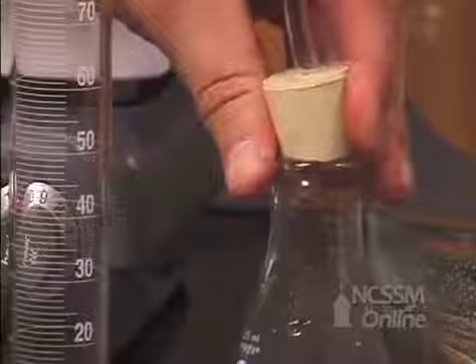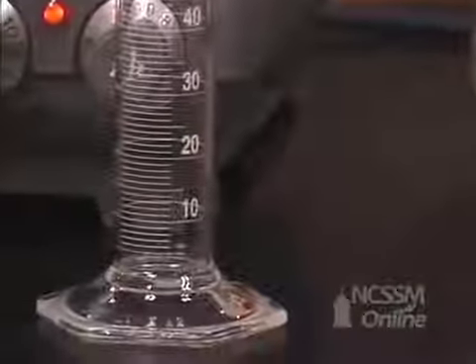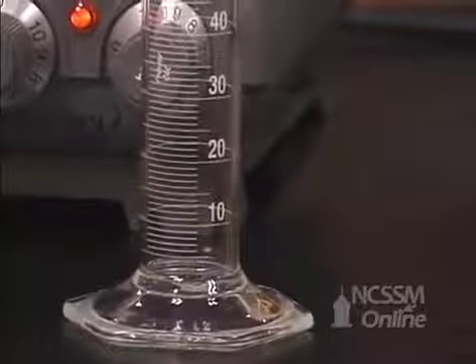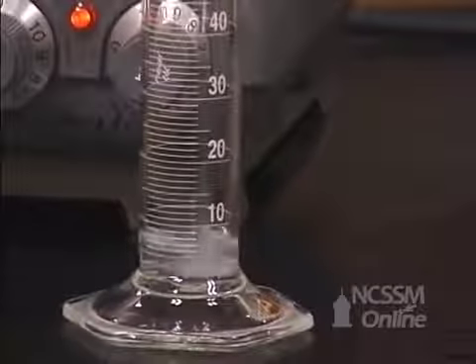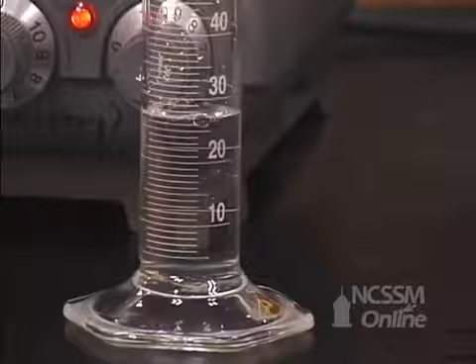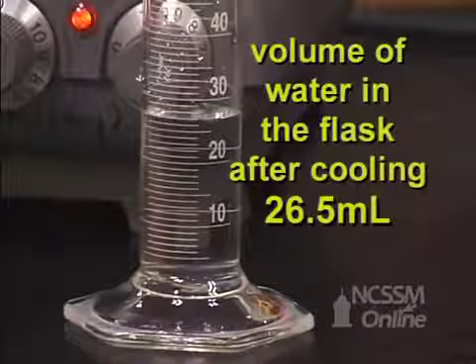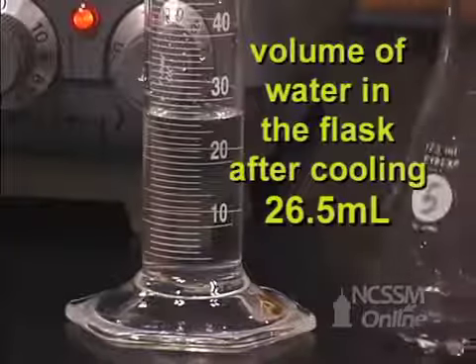We will carefully remove the rubber stopper from the flask and pour the water into a graduated cylinder. The volume of the water in the cylinder is 26.5 milliliters.